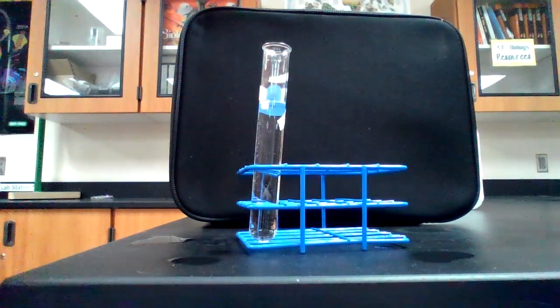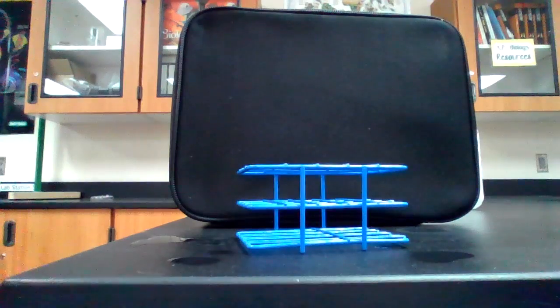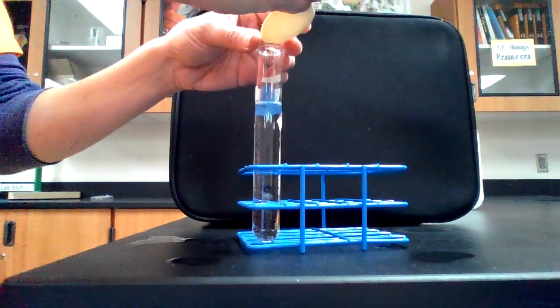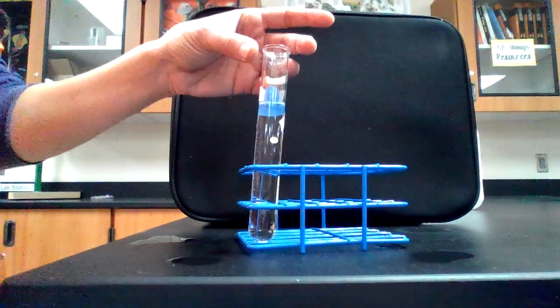No, not like that. It's possible some of these catalase spheres may have air bubbles trapped in them, and that might be why this is happening. So let's try, I have another one here. So this again, attempt at trial 3. Ready, set, go.